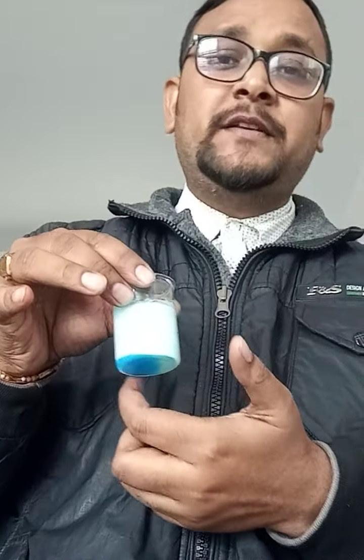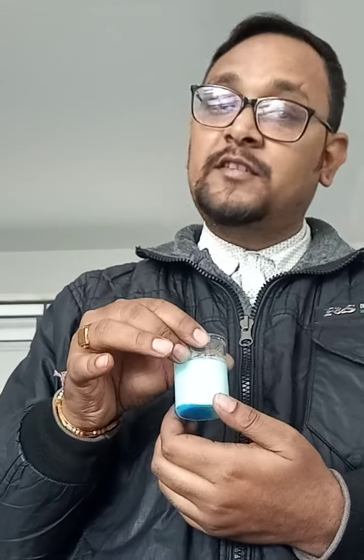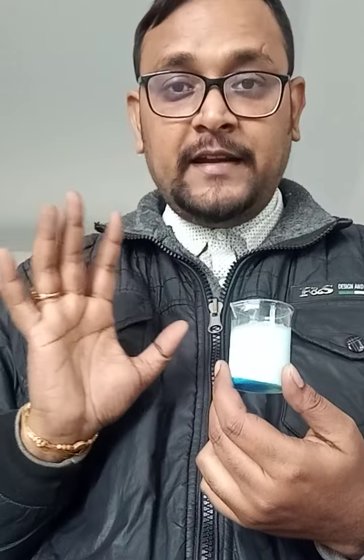I hope that this video will help, especially my senior students, class 10, 11, 12. You can easily identify that this white precipitate is of barium sulfate, which shows that it is sulfate radical. Hope this video was interesting and it has helped you to learn how we can identify sulfate with a simple technique.